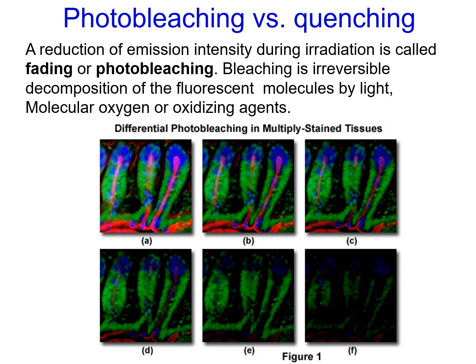And you see here an image that shows what happens when a sample is irradiated for a long period of time. Actually, what a long period of time is depends on the intensity of the radiation. If you're using a focused laser, that can be a matter of minutes, sometimes even tens of seconds. So it's important to develop molecules that have more robust fluorescence quantum yields that are not affected by the kind of non-radiative processes that cause decomposition, which is probably what's leading to photobleaching.